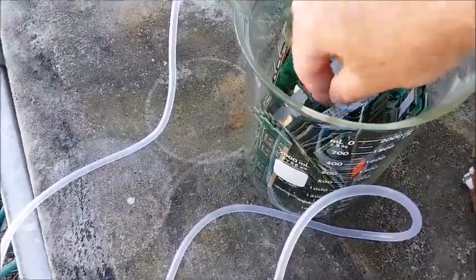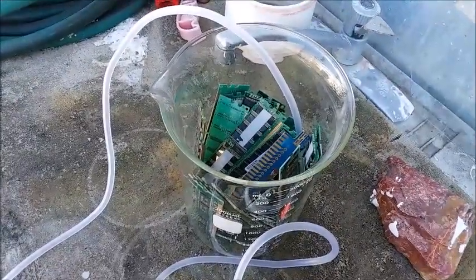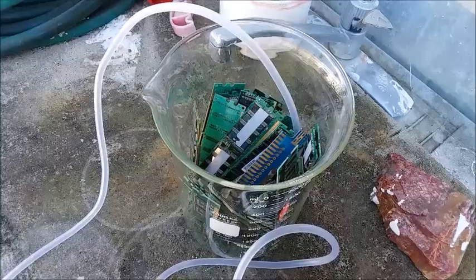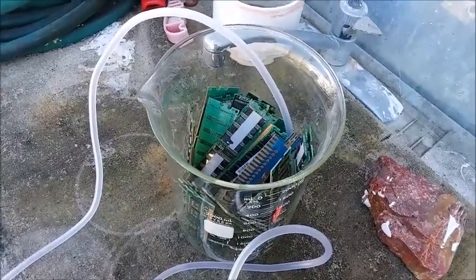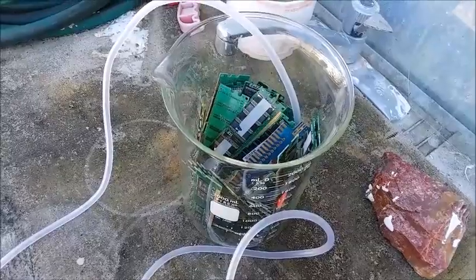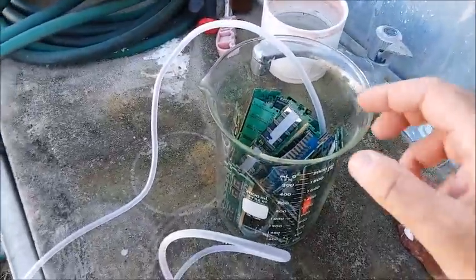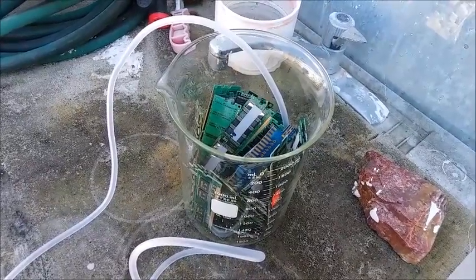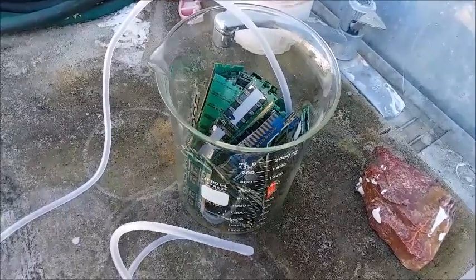I've got a lot of fingers in here - there's a lot less of the other stuff. No big chips with a hundred iron or copper pins that just sludge everything up. Hopefully this will be a lot cleaner with a lot less gunk to separate from the gold. I'm also taking advice I saw online: I've got a fish tank pump with a hose going down to the bottom of the beaker to pump air through and keep it agitated and add oxygen to the mixture.